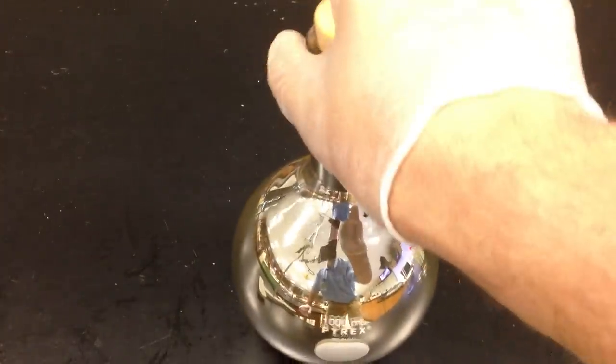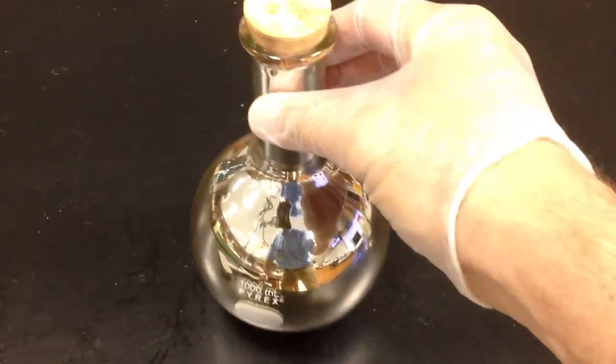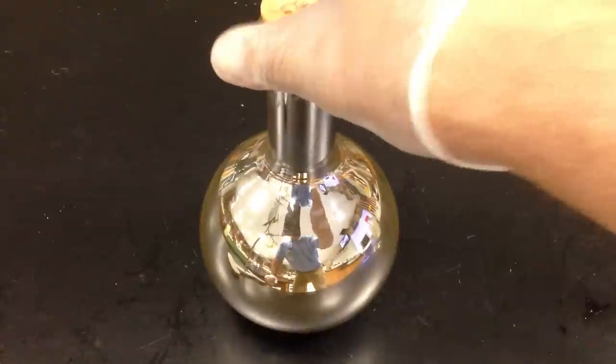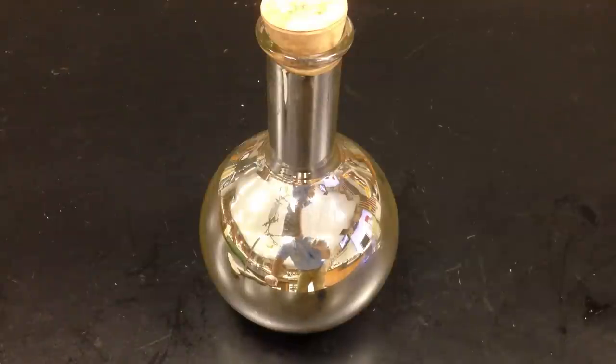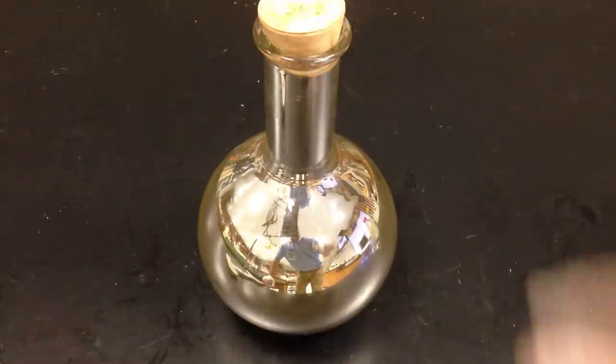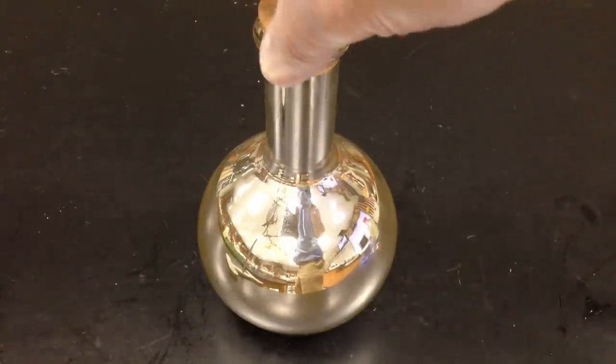I'm just shaking to finish this off and just spread out. Make sure the surface area is appropriate for the reaction to take place. And if you can see, I think we are as good as we're going to get. And we have ourselves a silver-plated Florence flask. Whereas you can actually see me waving back to you, behind my video camera. Very cool demonstration of silver-plating a glassware.